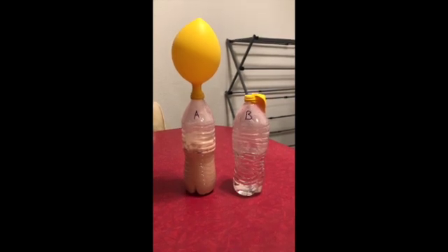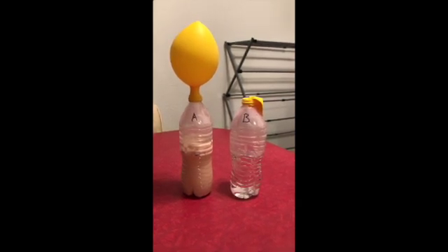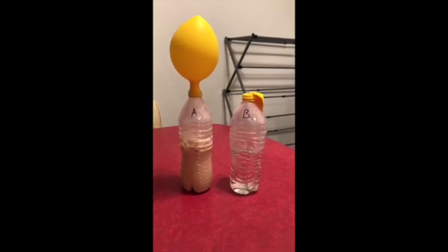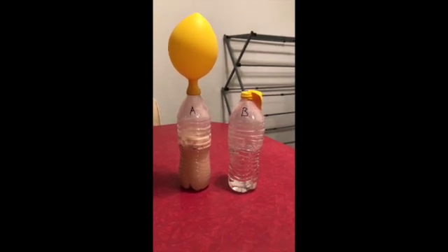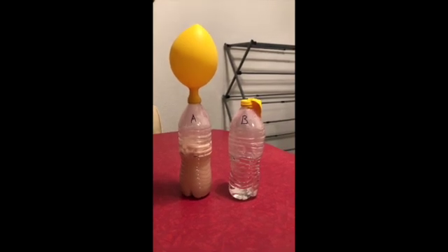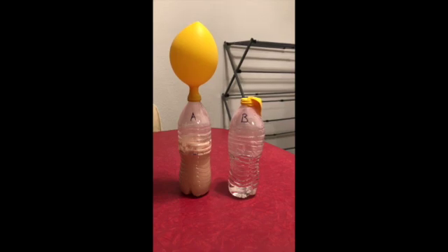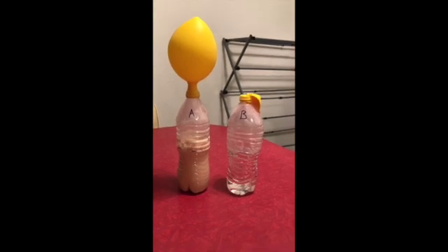Alright, it's now been 3 hours after the initial start of the experiment. In bottle A, you can see that there is carbon dioxide that has filled the balloon. Also, there have been bubbles that have risen from the initial line 1 when we first started, and they've gone down since then. Also, the water in bottle A is cloudy, and there is sediment sitting on the bottom of bottle A. In bottle B, there has been no change besides the dissolving of the sugar. And then also there's been a vacuum created in bottle B due to the temperature change.